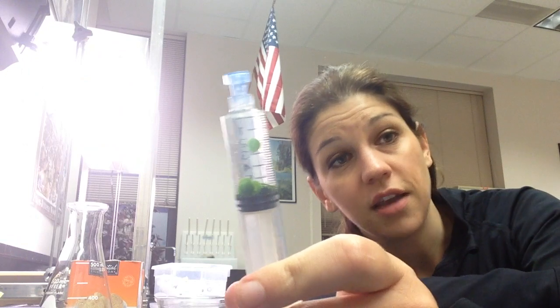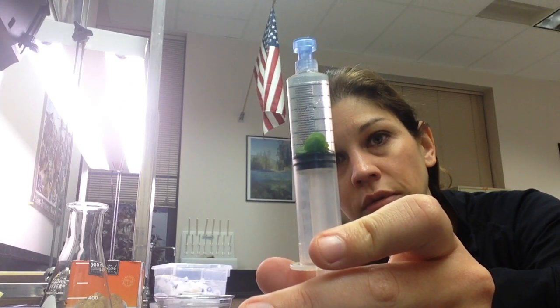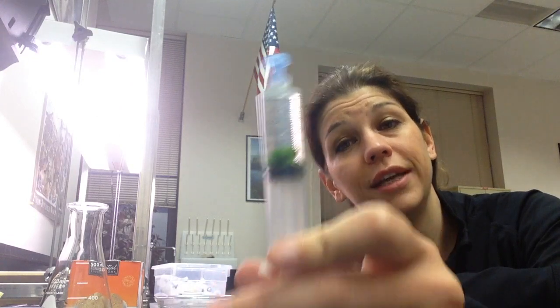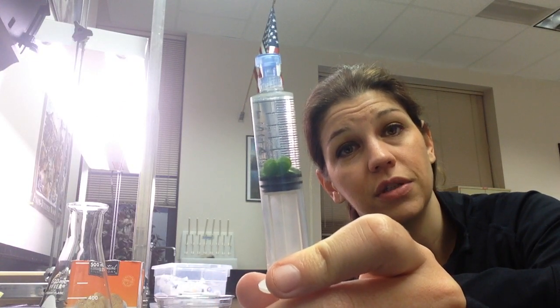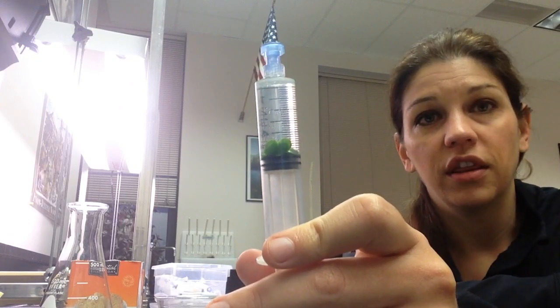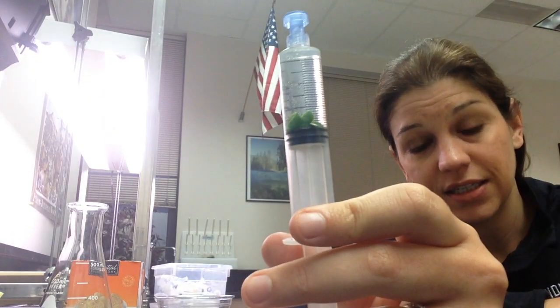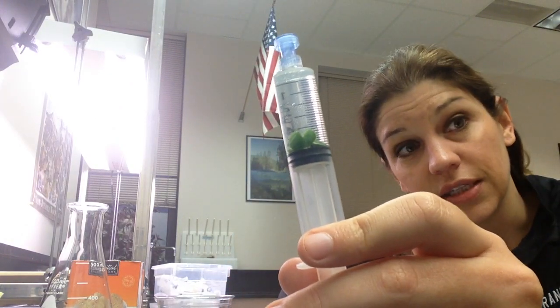Usually that's not normal — it normally takes two or three tries to get the discs to sink. If you have to go into a fourth attempt, you're usually doing too much damage to the discs, and then they won't photosynthesize when you put them back in the cup. So with that in mind, I've been successful — I've gotten all 10 of my discs to sink and I'm ready to test the rate of photosynthesis.